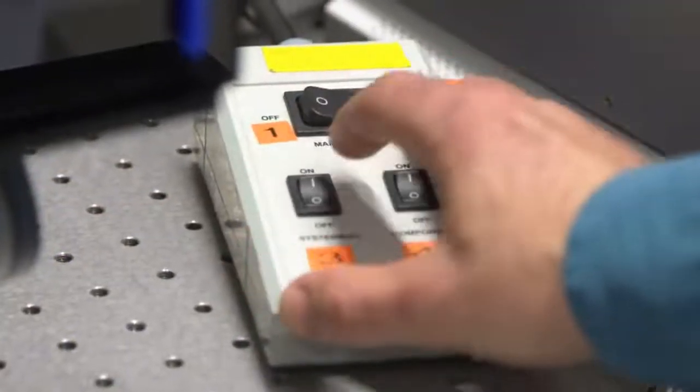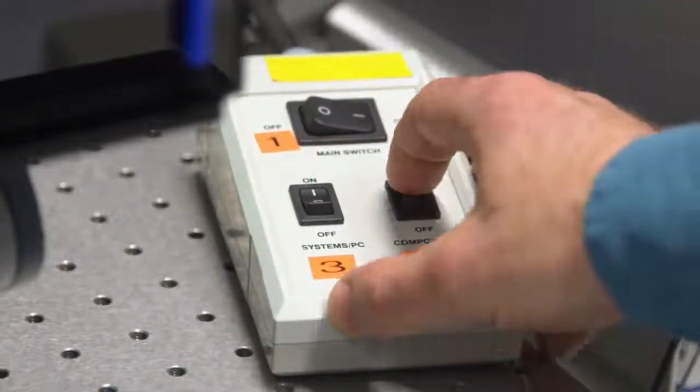Switch on all of the components of the microscope, including the lasers, and select a high-magnification, high-numerical aperture objective.